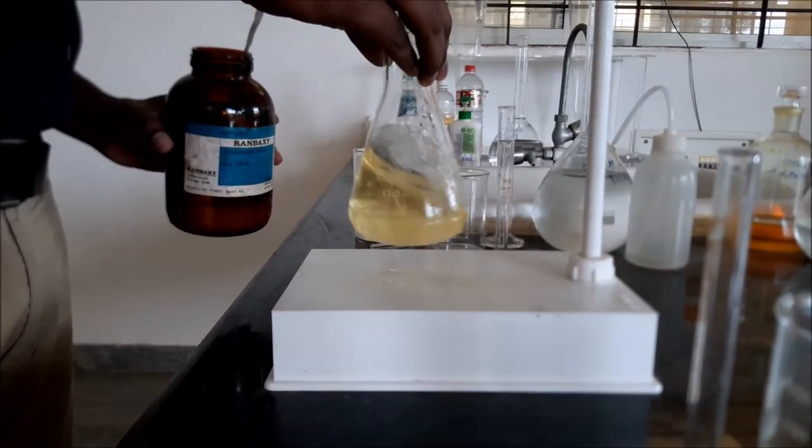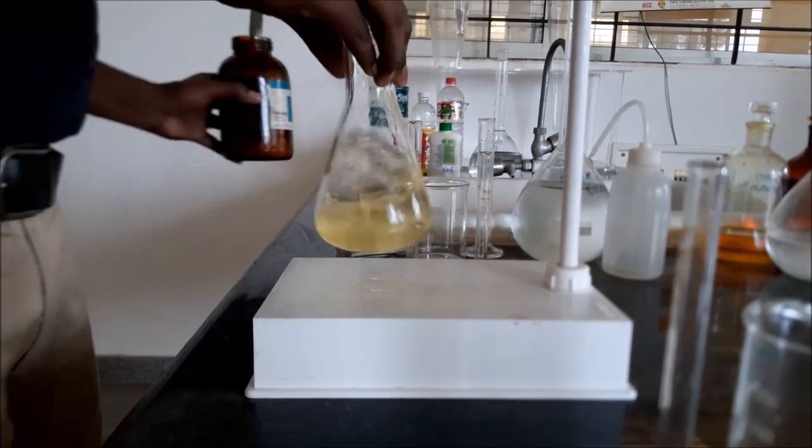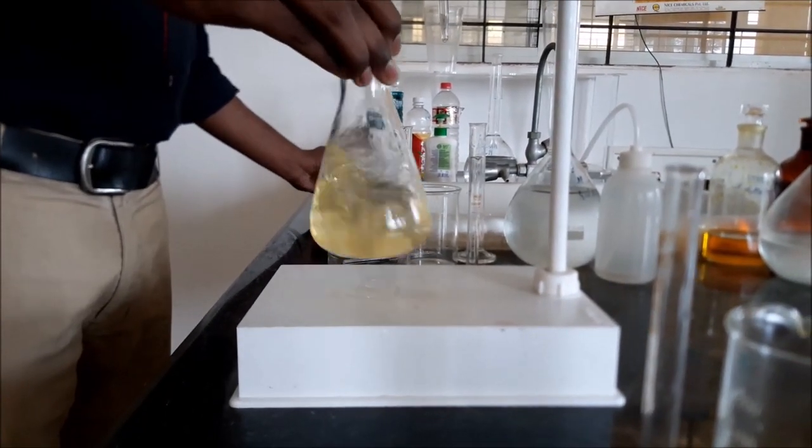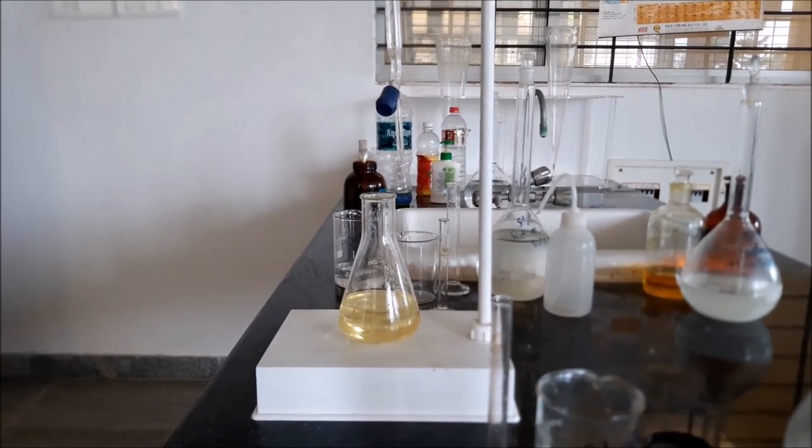There is a slight change in the color. It has changed to pale yellow color. Now this will be titrated against standard sodium thiosulphate solution.